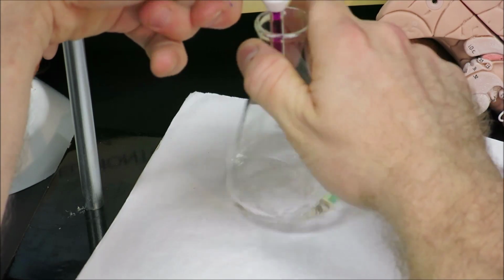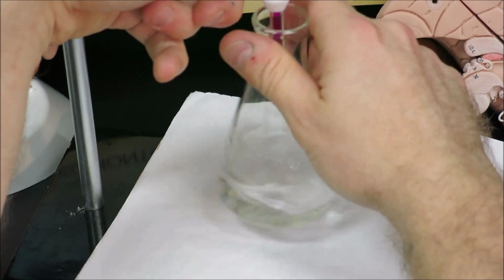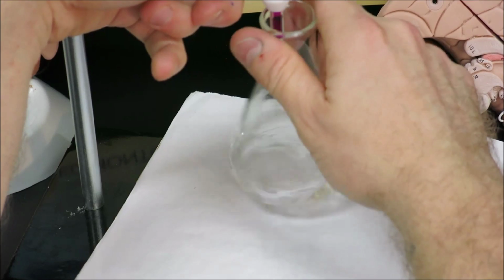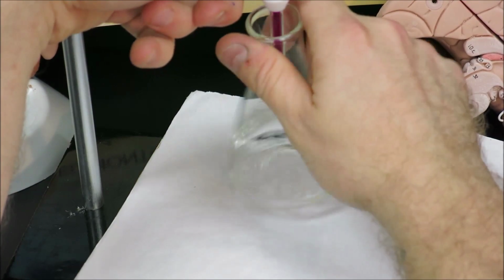But it is important to remember the concentration is diluted 40 times. So the final concentration that is calculated must be multiplied by 40 in order to calculate the concentration that was in the bottle.